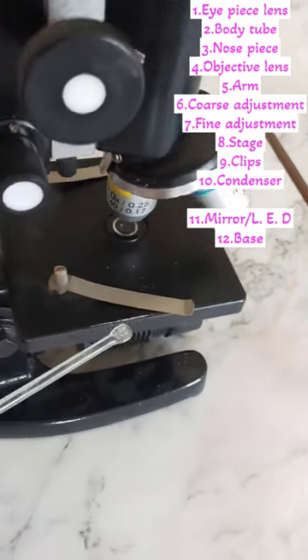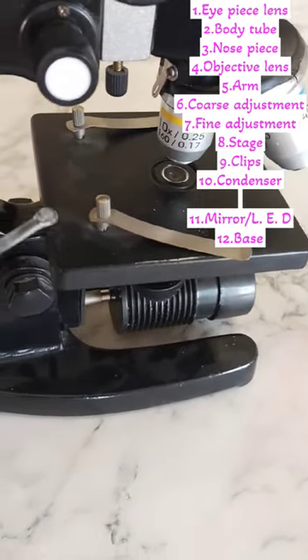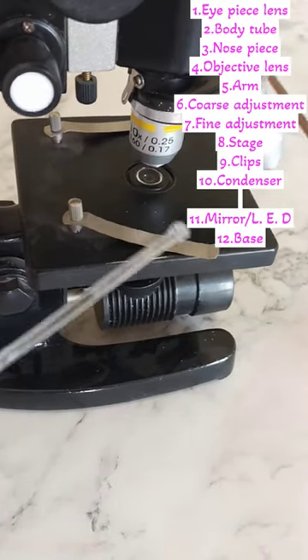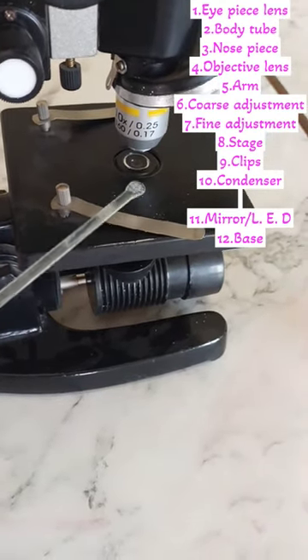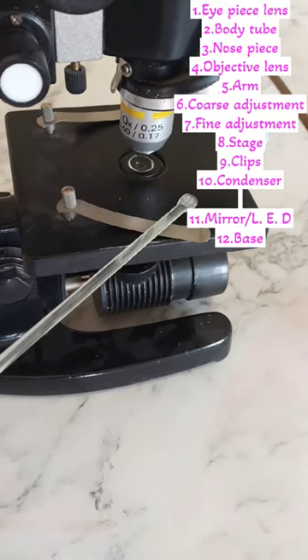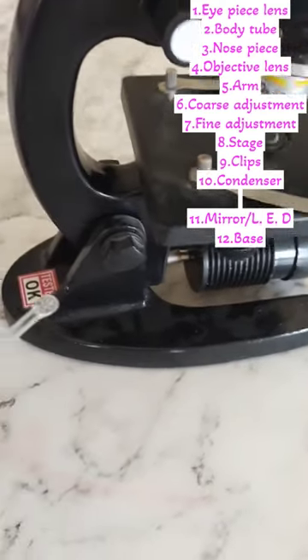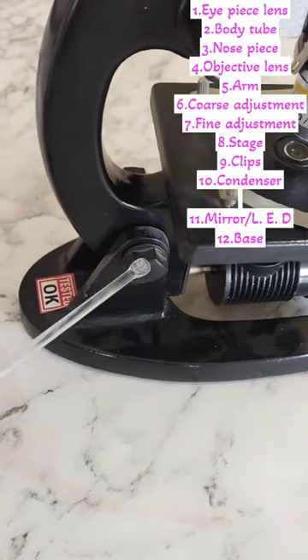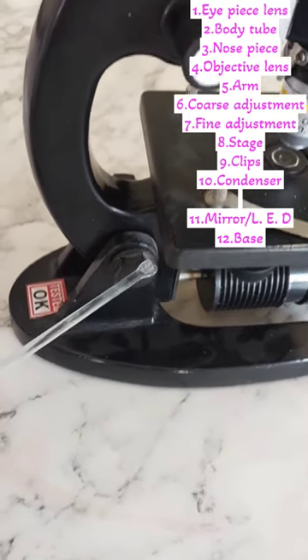You can see that there is a square structure present below the objective lens. We call it the stage. There are two clips on the stage — this is the place in the compound microscope where we can fix the glass slide with the specimen.